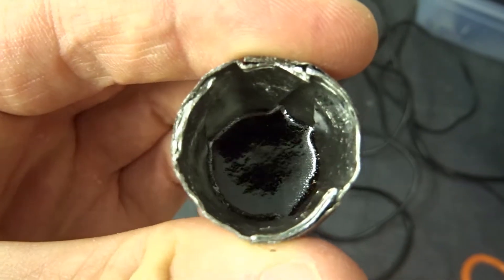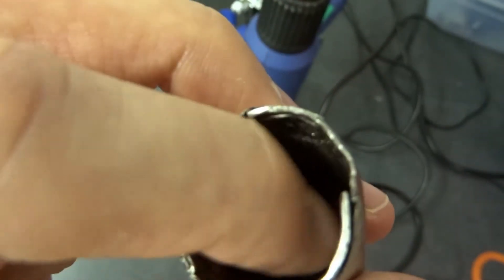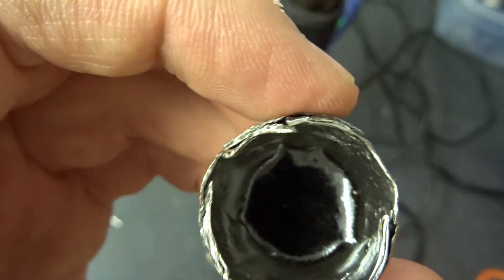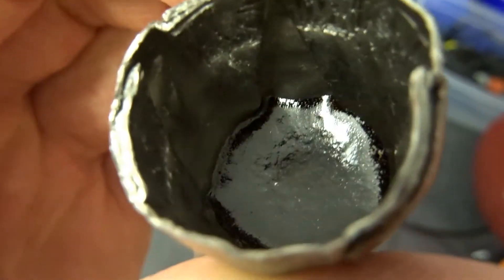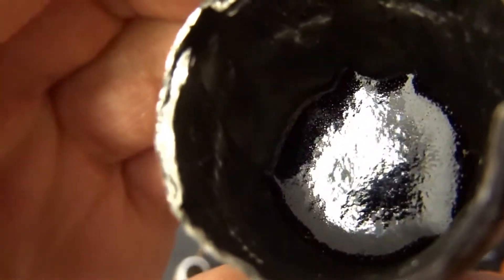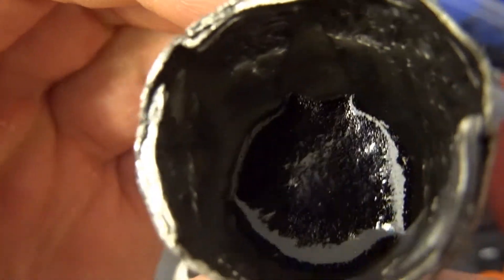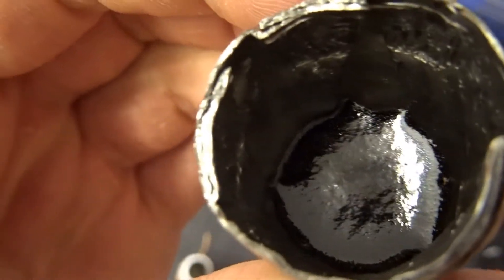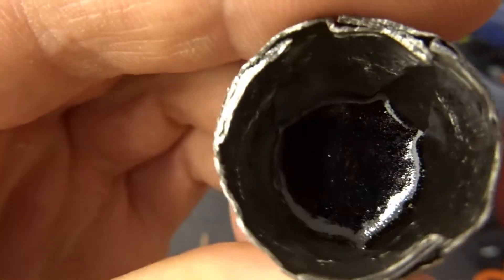And look at that. I mean, that's almost mirror finish. That's great. I'll try to give you a very good closeup on my bakelite. So it worked flawlessly. It's a nice dark bakelite.